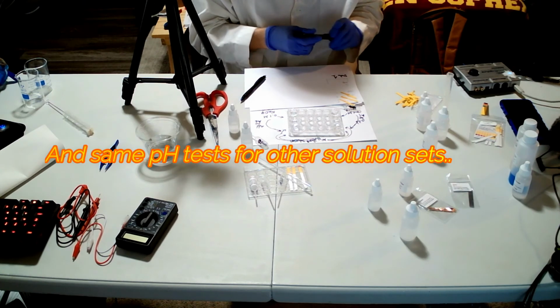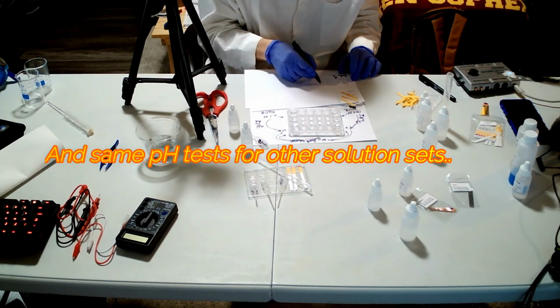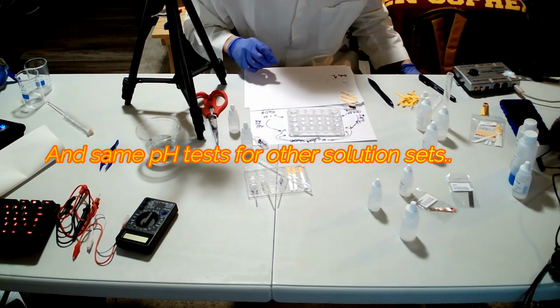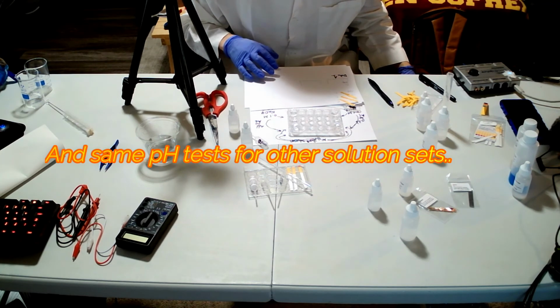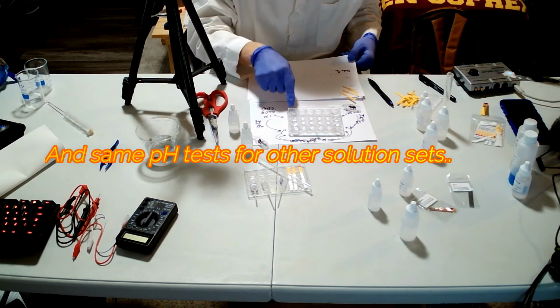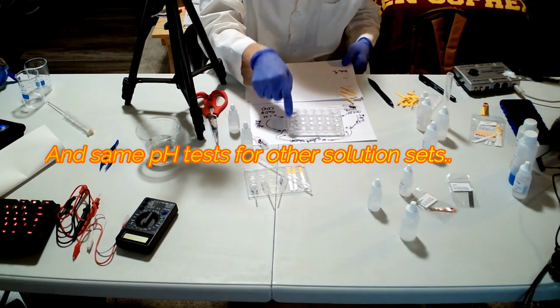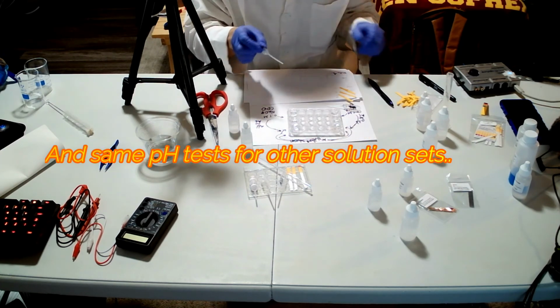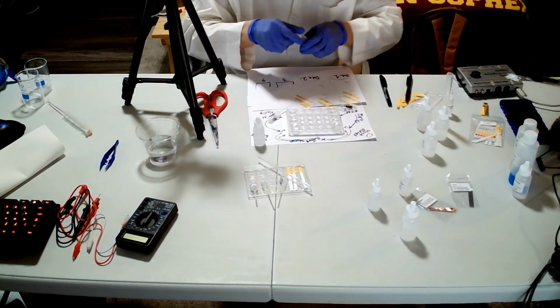Right? So I will need the different set. The next step is adding 0.1 molar of the NaOH, which is here, to A6. So I'm gonna need a different pipette.